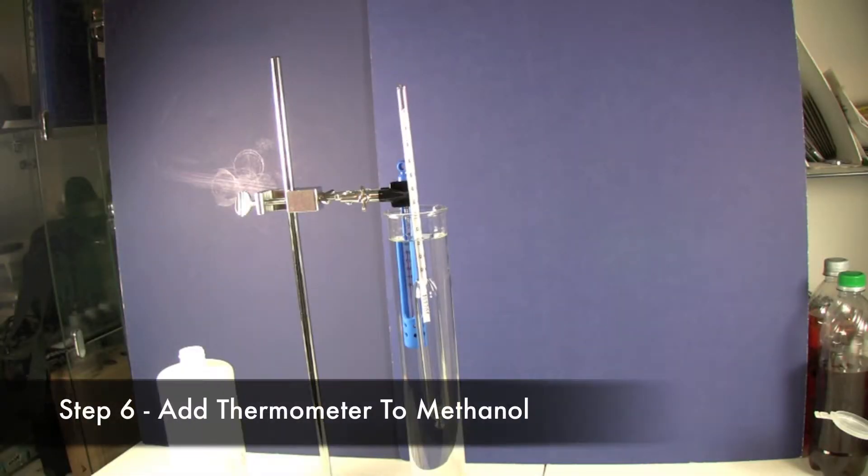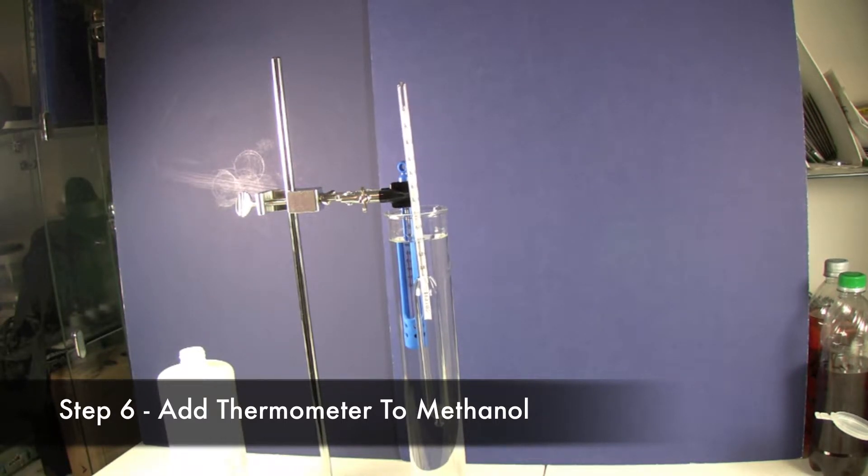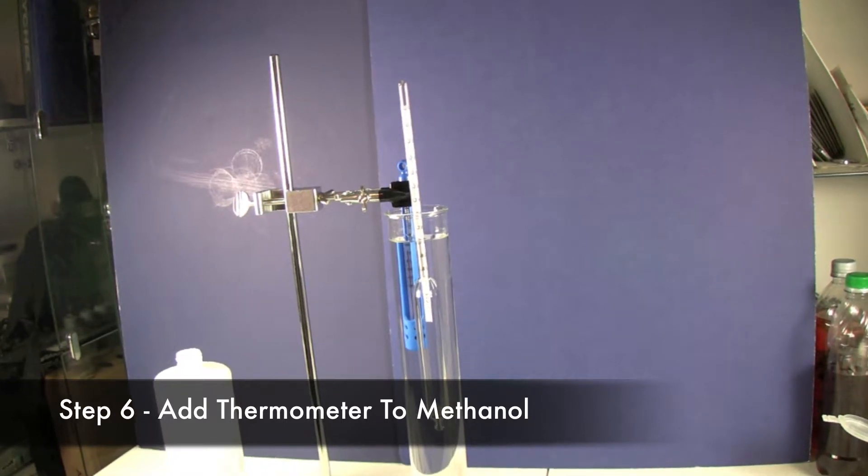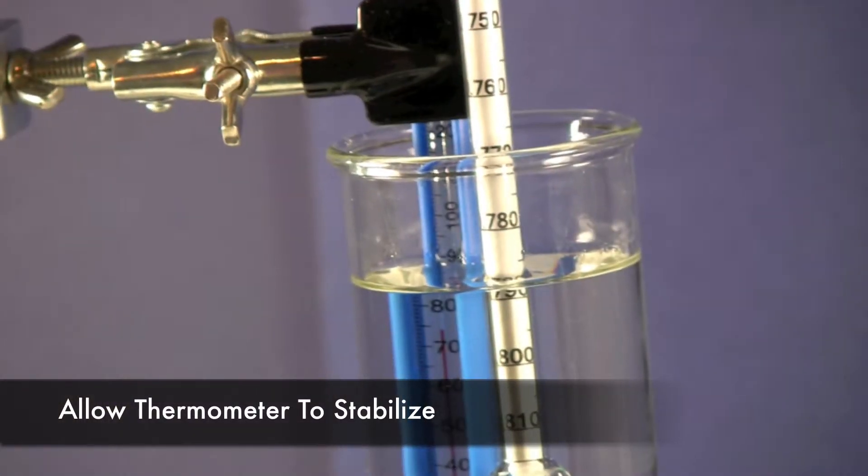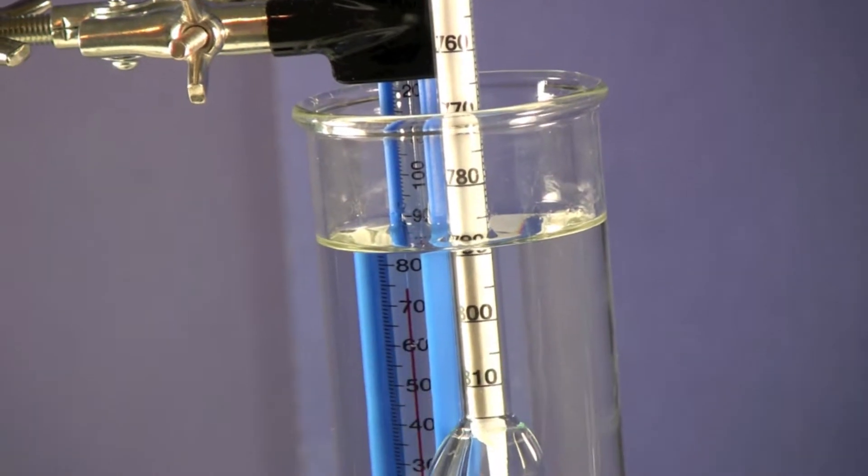So I've mounted a thermometer which we get with our ultimate methanol test kit into this methanol test. And we're going to just let it kind of stabilize here and see what the temperature comes up at.